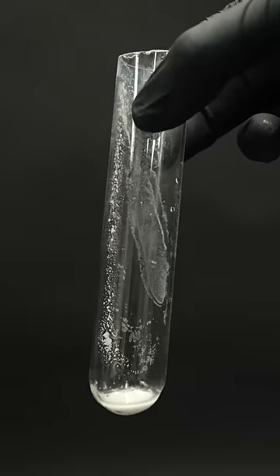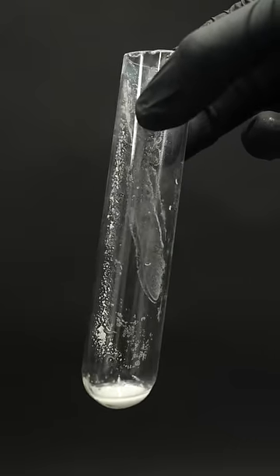In the test tube, there's still a bunch of white stuff, and this is all just filler that was in the pills.